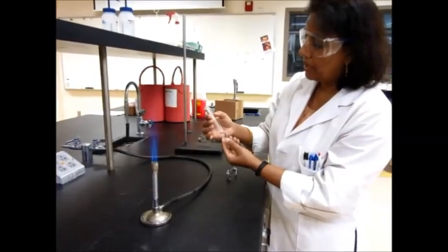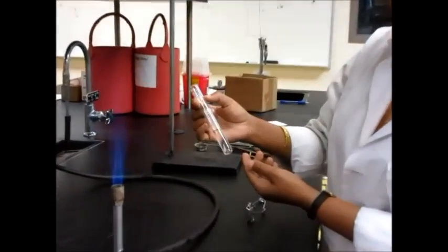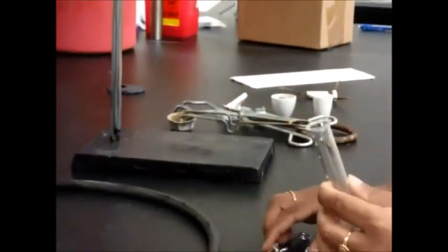Now, it may be filled up to here, so be very careful, or even if it's filled up to here. Please be careful.